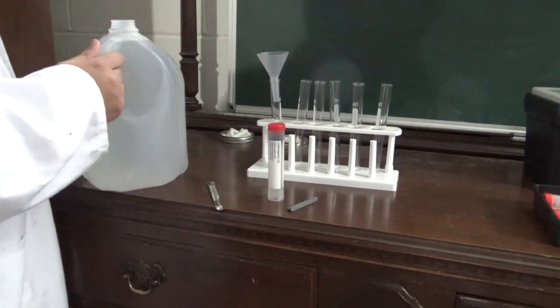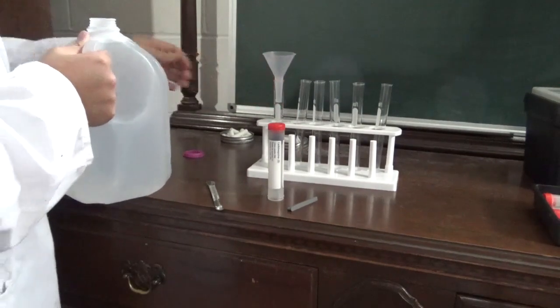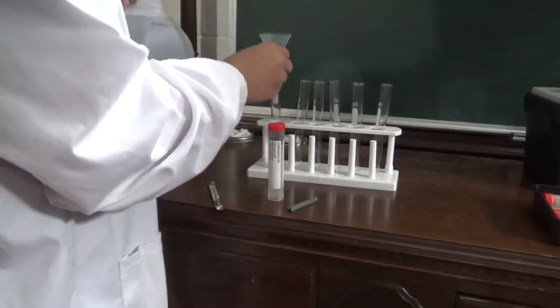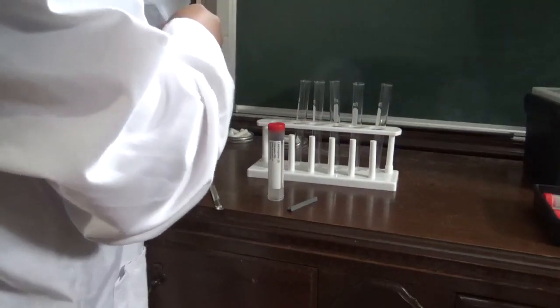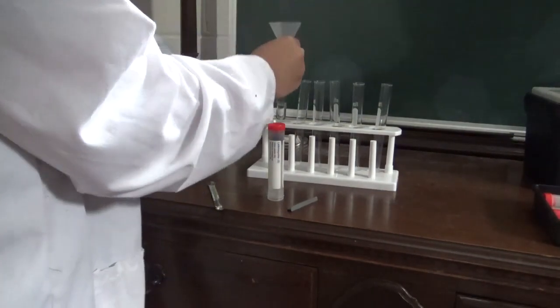We're going to pour in some distilled water into this test tube right here. Now again, I am literally guessing. I've got no idea what I'm doing because, again, the tutorial said to measure in centimeters, which is not how you measure water, but whatever.